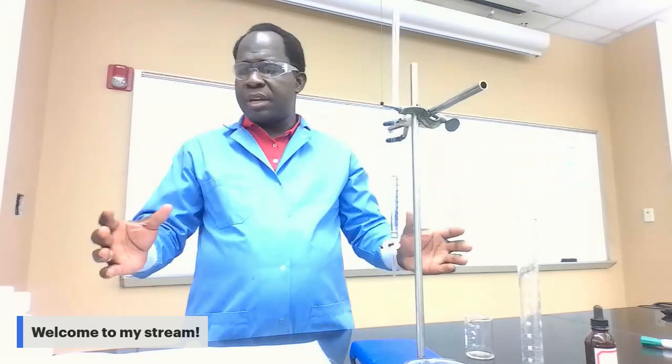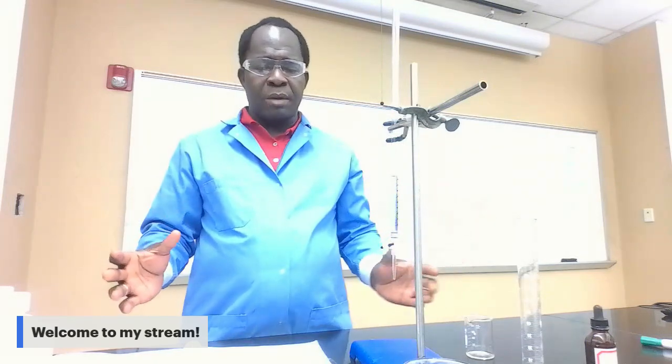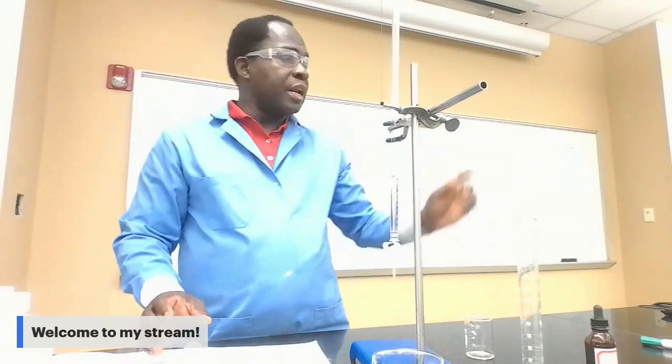Now you're done with the titration part of the lab. Make sure you clean up. When the titration is over, make sure you clean up. So clean up means here you're gonna dump those solutions into the liquid waste we have in the lab. If you have HCl solution inside the burette, make sure you drain the rest of the HCl out. That's what I'm doing now.